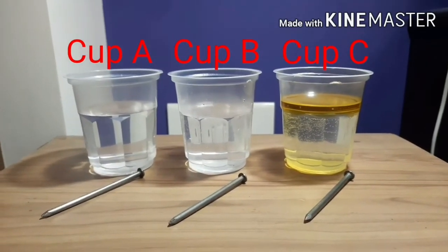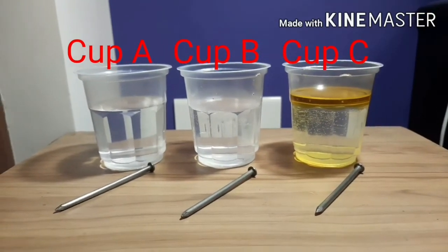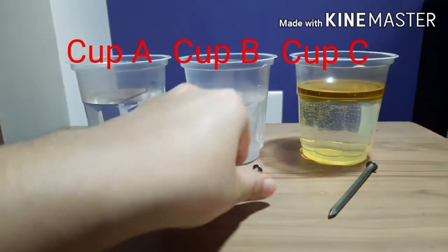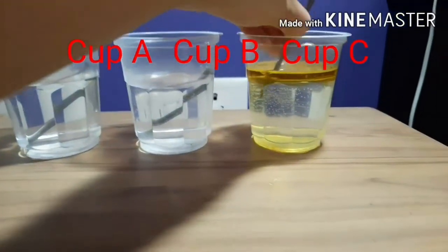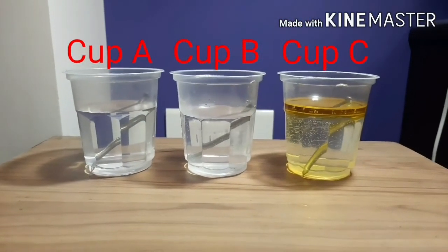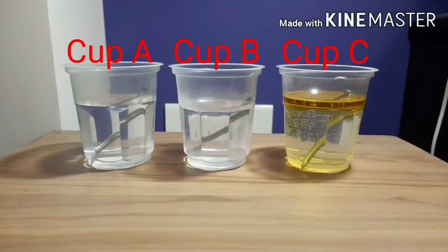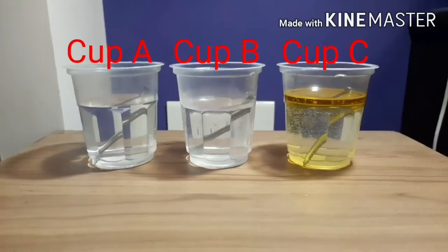Now children, you can also see that I have kept the 1 iron nail in front of the cups. What I will do is, I will immerse each iron nail into every cup. Okay, immerse the iron nail into the cup. Now we will leave this setup for about 1 week, and then after 1 week we will observe what will happen to each iron nail.